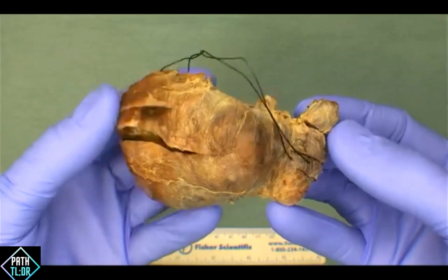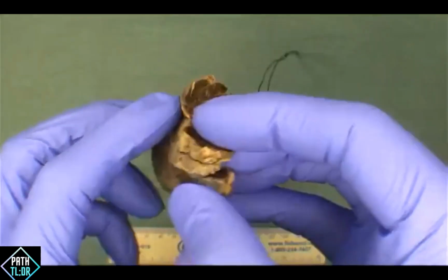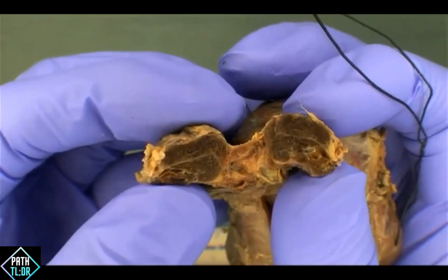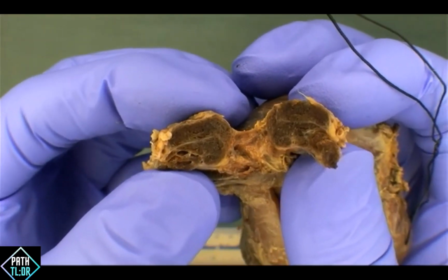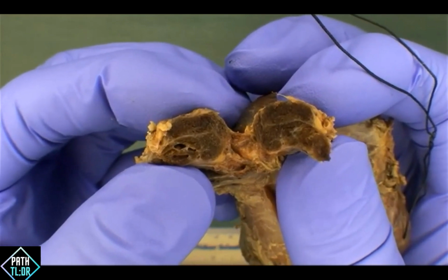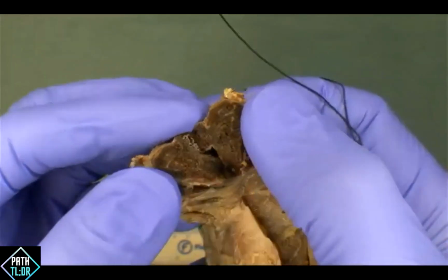Yeah, it's asymmetrical. This is the right lobe here, and you can see how much bigger it is by comparison to the left lobe. Okay, so taking a look at the cut surfaces, here's a nice example of what normal-looking thyroid tissue should look like. Okay, it's nice dark brown, beefy red, exactly, depending on just how long it's been fixing. Obviously, if it's been fixing for a shorter period of time, you might expect it to be a little bit more pink, a little bit more red. But this has been fixing for a couple of days now, and so we've got this nice dark brown appearance to the lobe.